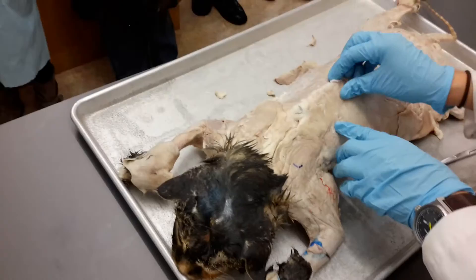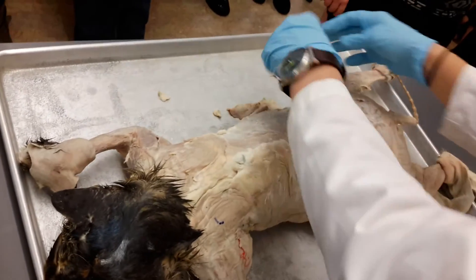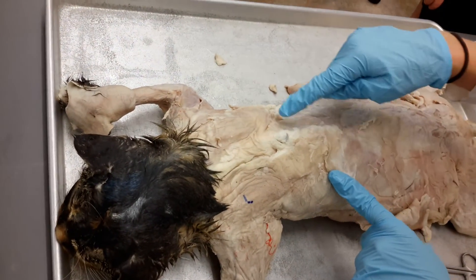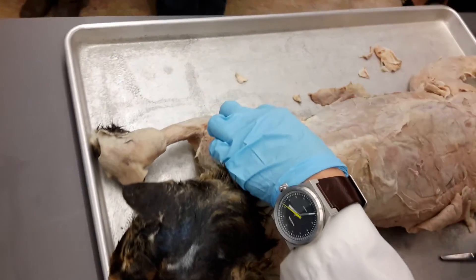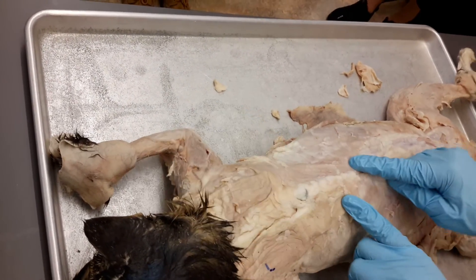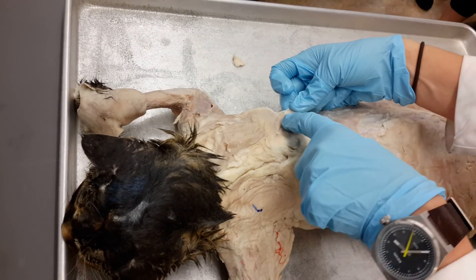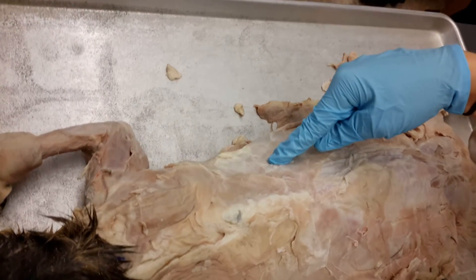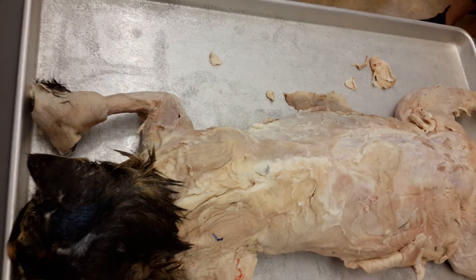All you have to do is just peel back any skin or fat that's there and it's going to come right off. Once you do that, you're going to expose the muscle. All we want to do is look for the separation between the trapezius and latissimus dorsi. I found it right here — I just looked over here and saw a little white line, so I separated it out. The cat's trapezius looks just like ours — it's going to run up like this. So if you see a pin next week here, trapezius. If you see a pin next week down here, latissimus dorsi.